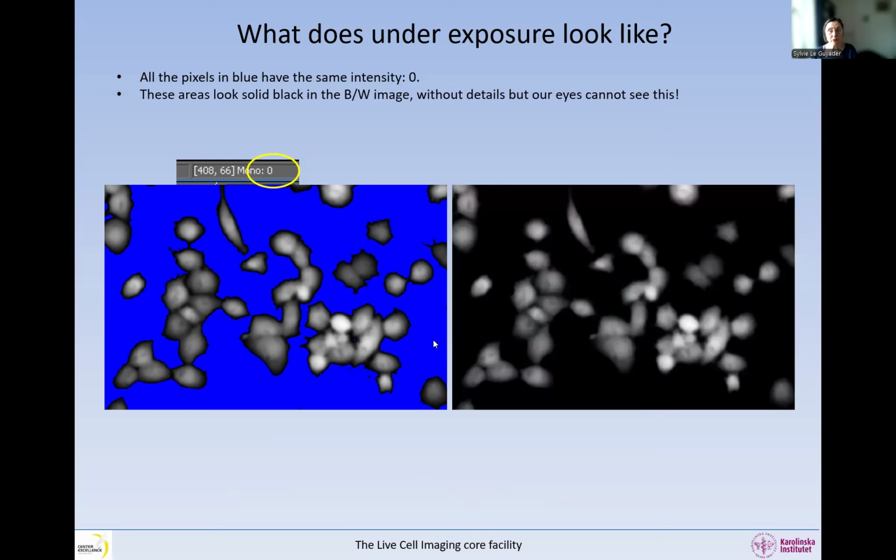So if we remove the color mask, it's very difficult to see. With a trained eye, you will be able to identify saturation without the saturation mask. But underexposure is pretty much impossible to see because we're so used to having a black background anyway. So this is an artifact of microscopy. And again, the blue pixels are underexposed.